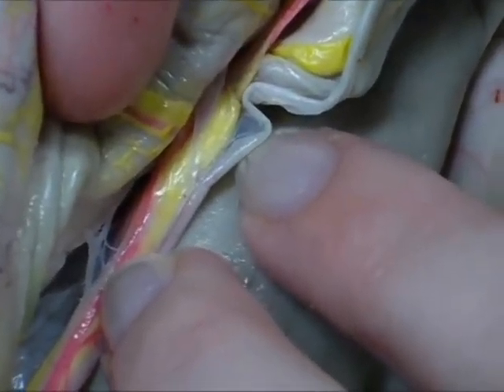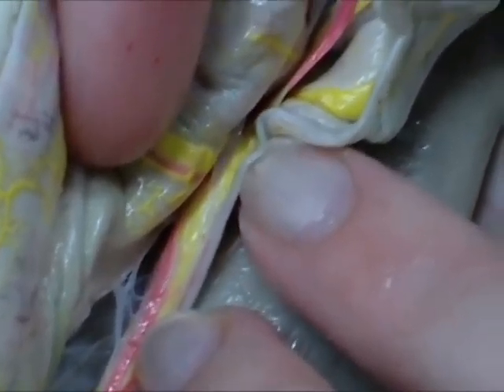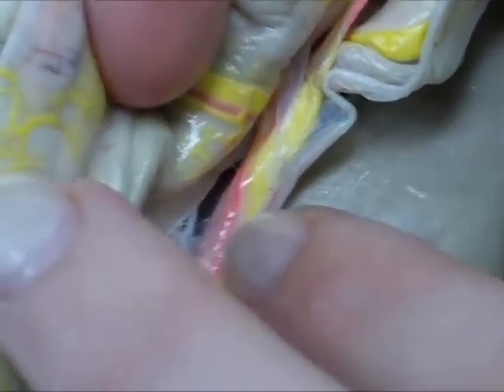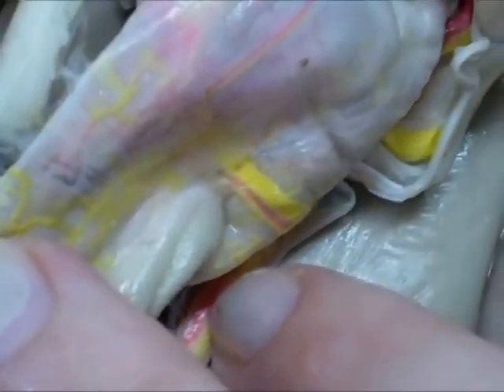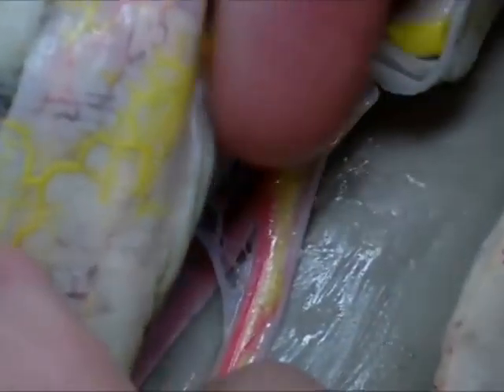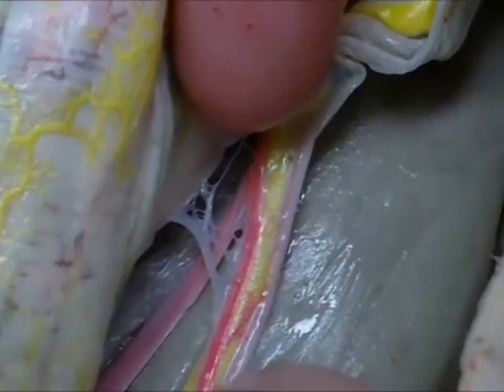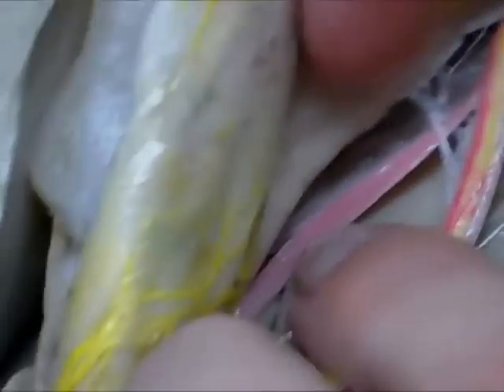The bile duct is this whitish structure you can see at the bottom there. Along with that is the hepatic portal vein, which is the yellow, and the hepatic artery right next to it, and the celiac artery, which is on here.